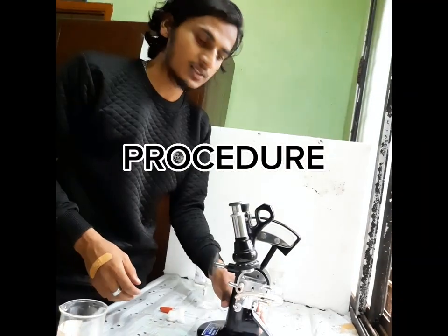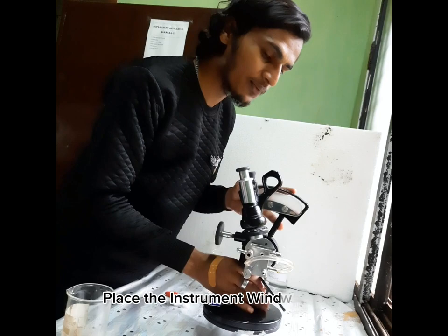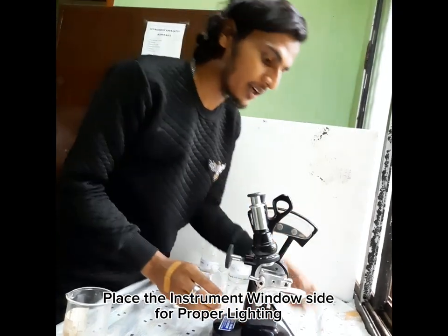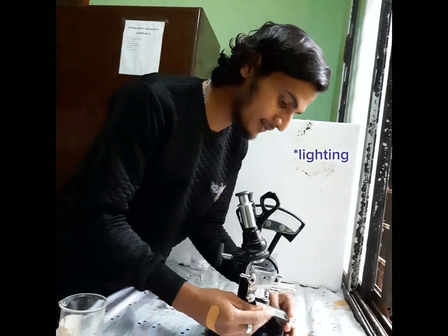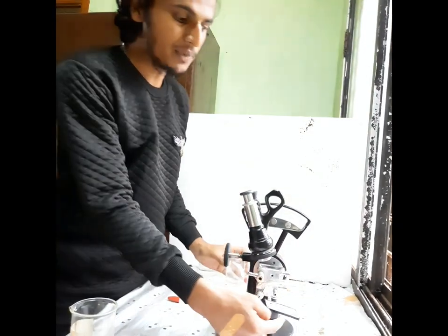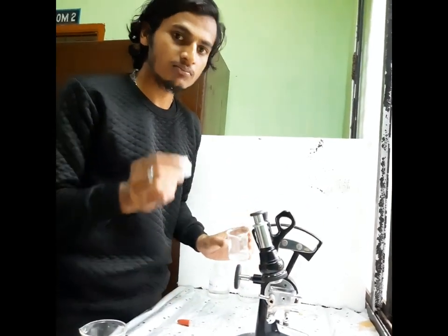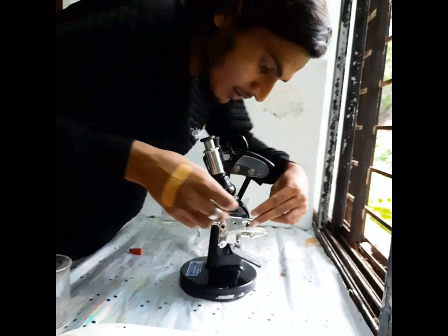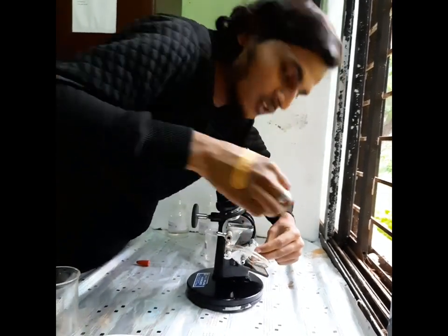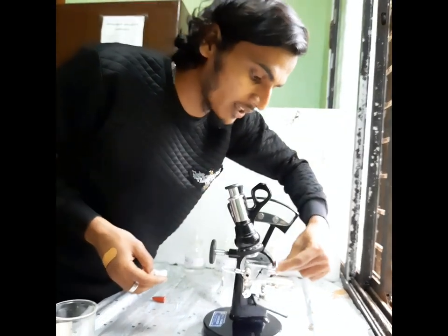Procedure of this experiment: we have to place this Abbe refractometer on the window side to get proper lighting. And we have to clean the mirror as well as the prism box by using acetone and cotton so that there should be no grease, dust, or stain.